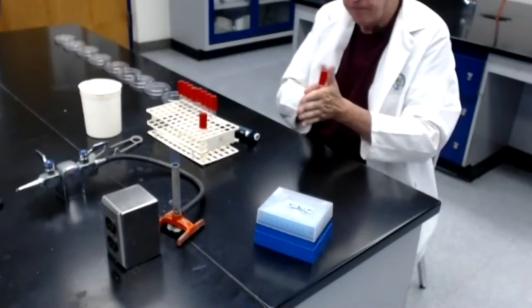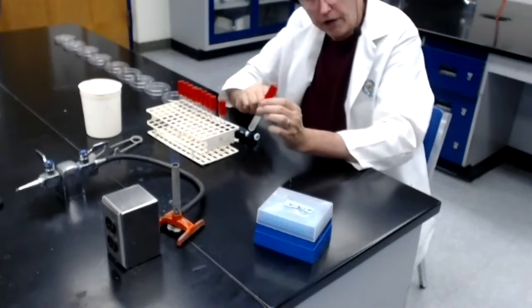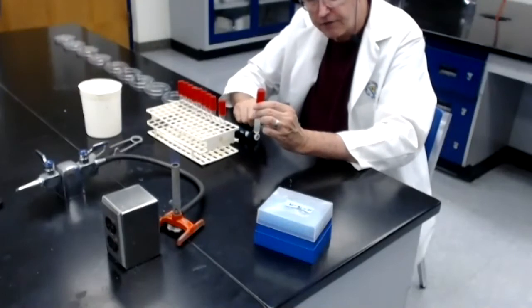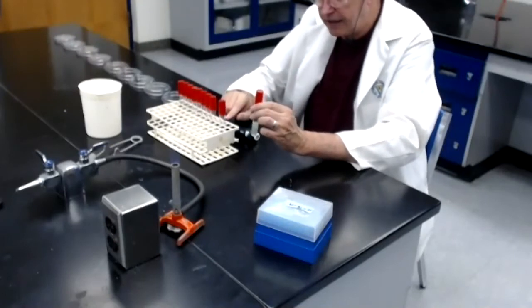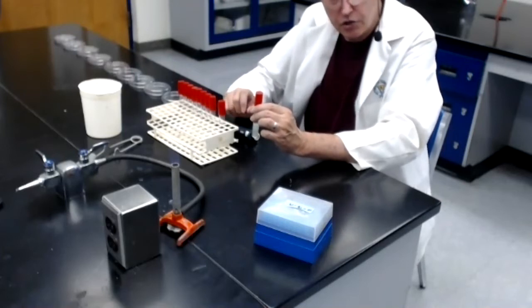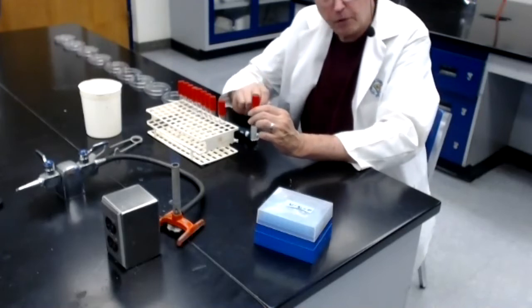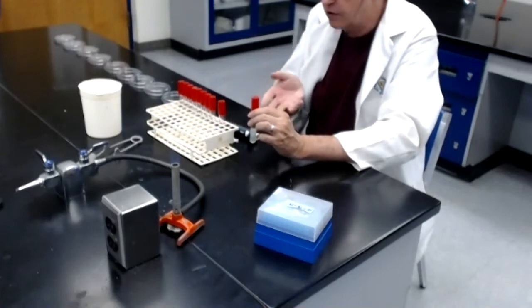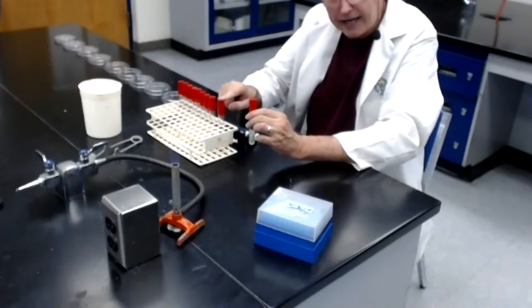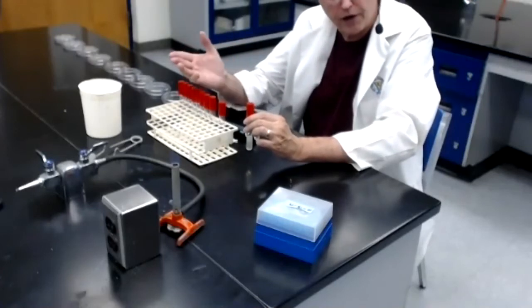Recall what I just did. I took tube number 1, which was a 1/10 dilution of the milk sample, mixed it. I transferred 1 mil from tube number 1 into the 9 mils of tube number 2. Well, 1 mil plus 9 mils is a 1/10 dilution. So what I did was I just now made a 1/10 dilution of tube number 1. But tube number 1 itself was a 1/10 dilution of the milk. So the total dilution of the milk in tube number 2 is a 1/10 times a 1/10, or a 100th, which is why tube number 2 is labeled 100.